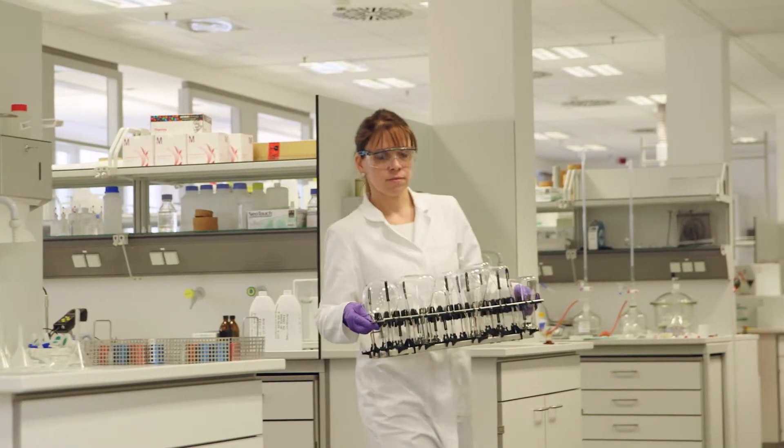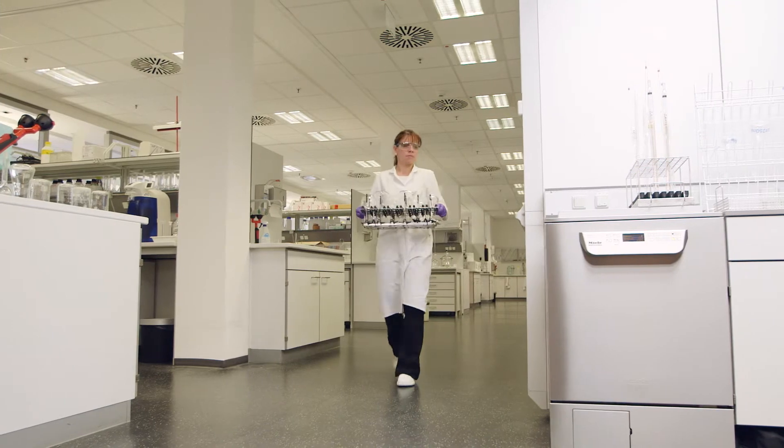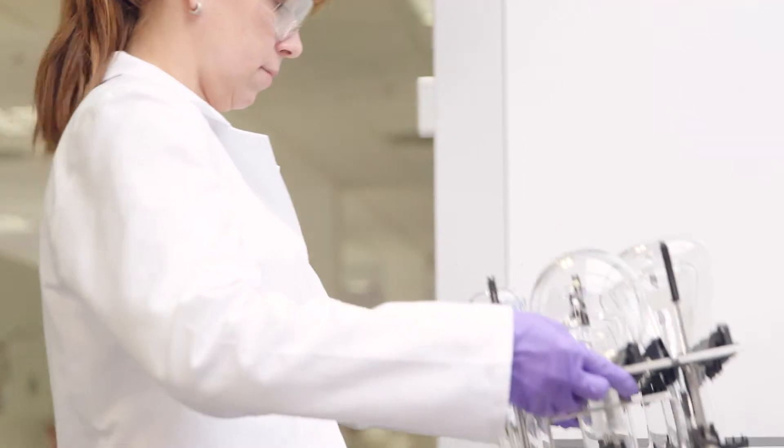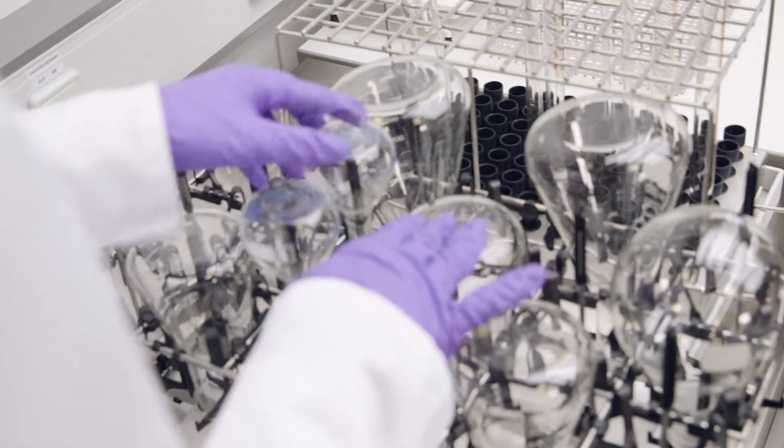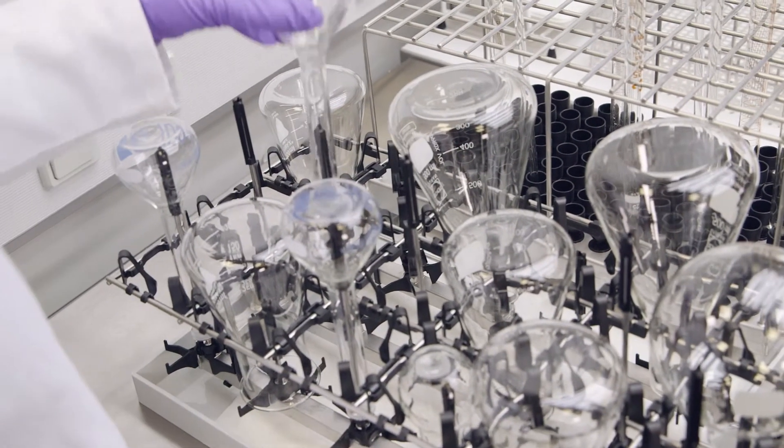Correct placement of the load carriers is important to ensure the best possible results. Make sure that there is enough space between the glasses so that they do not clash against each other and can be thoroughly cleaned.